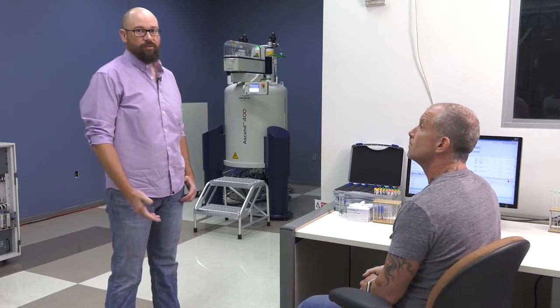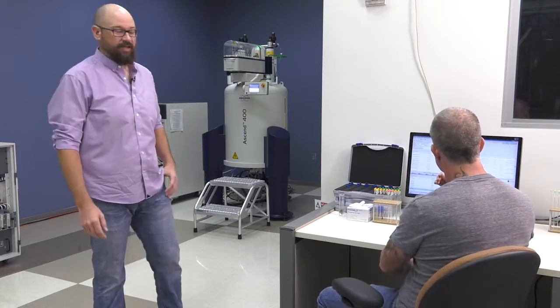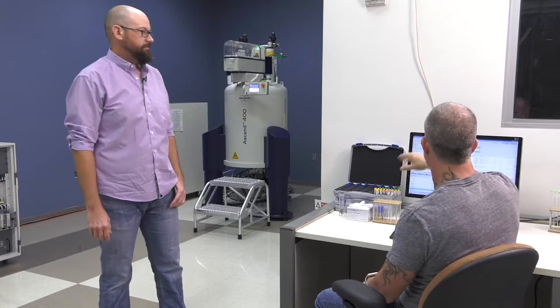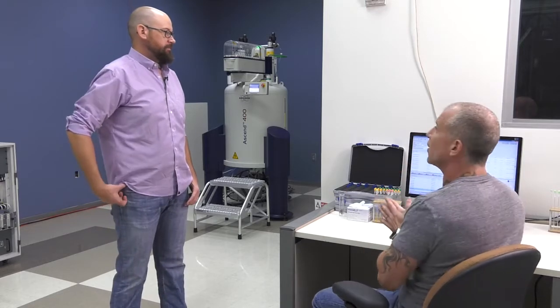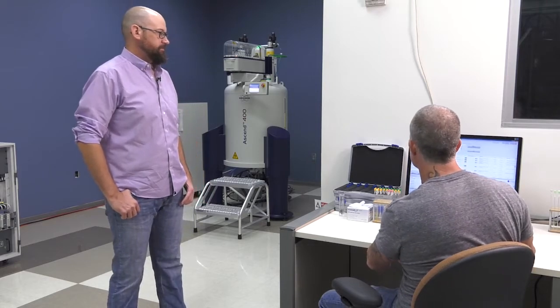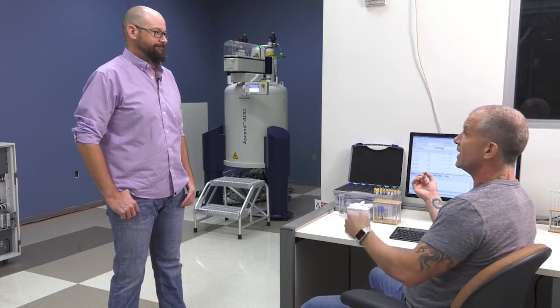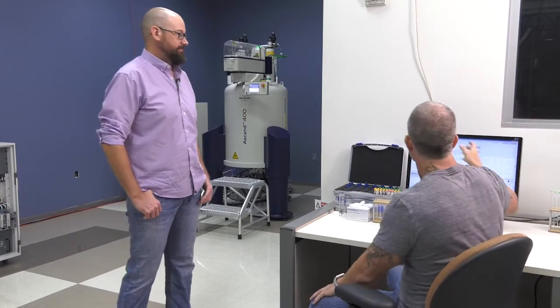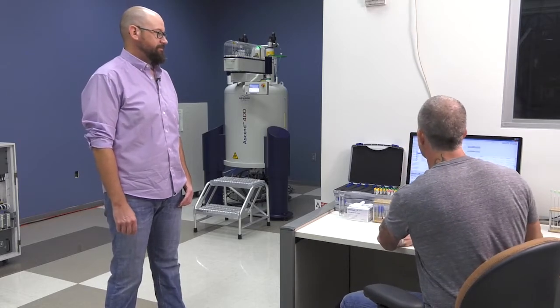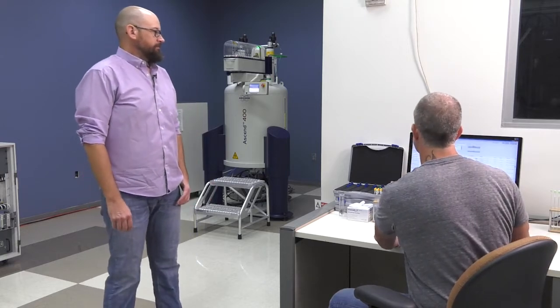Okay, Jeff, the first thing you would do is enter information about the data for what you want to store this as. So give a sample name for your file. So we're running Icon NMR, is what it says at the top. So this is Bruker's software for automation? Yes. And the steps you go through are to enter a sample name, and I assume you can enter any name you want? Right, yes. The solvent is a drop-down menu, and it looks to have most common deuterated solvents. So you need to know what solvent you put your sample in, right?